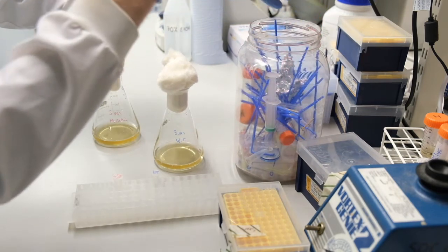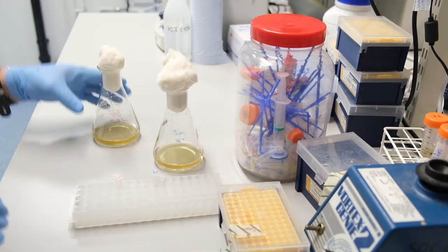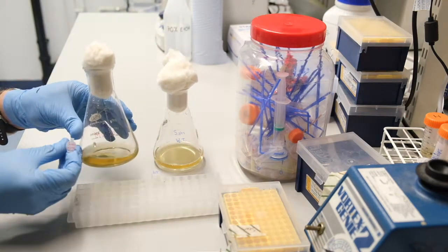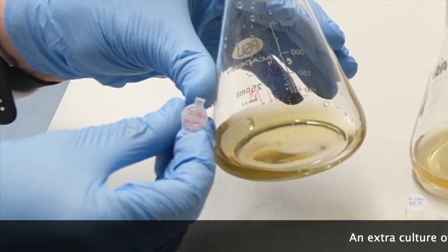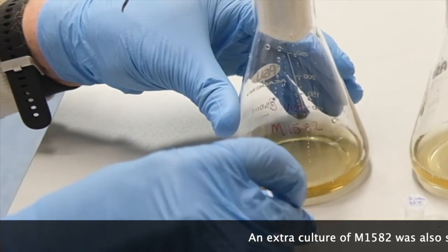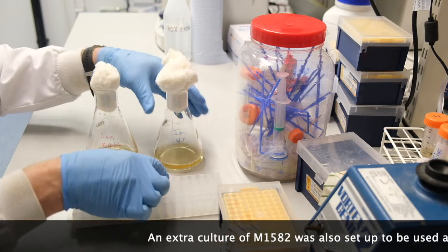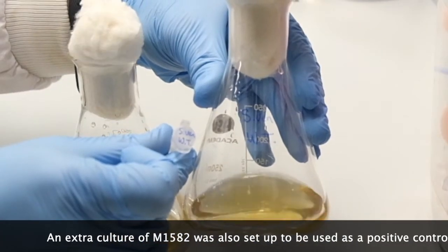Each culture is inoculated with spores of the corresponding strain. M1582 with M1582 spores. Wild type with wild type spores.